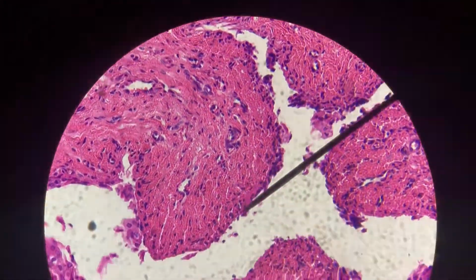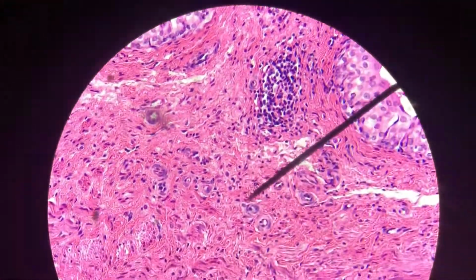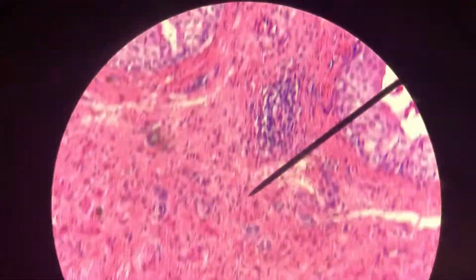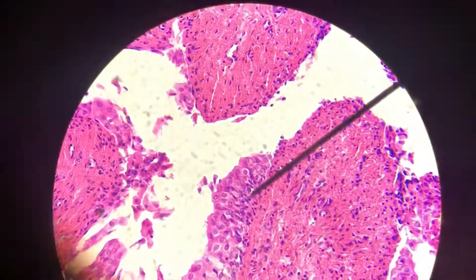So, yeah, if we come down through here, you'll see there's our connective tissue, and then we get to our smooth muscle. So that's how we know it's bladder, is by seeing everything. You're like, lady, how am I going to see everything? I can't move this scope. Well, I'll find you a good slide from your lab guide or from the other lab website.